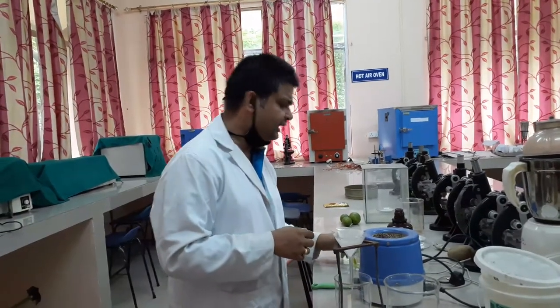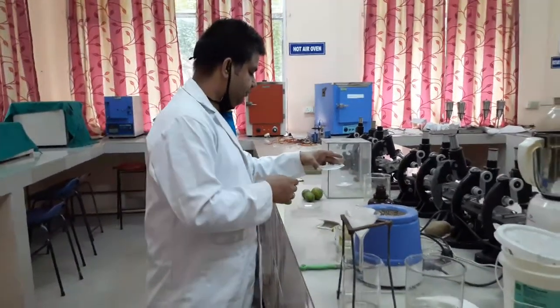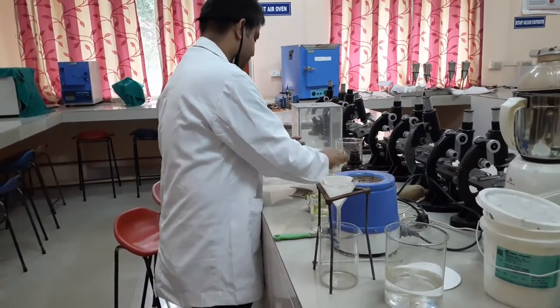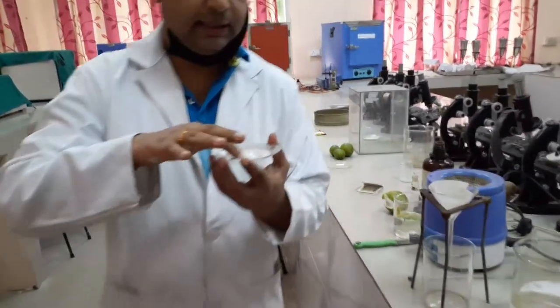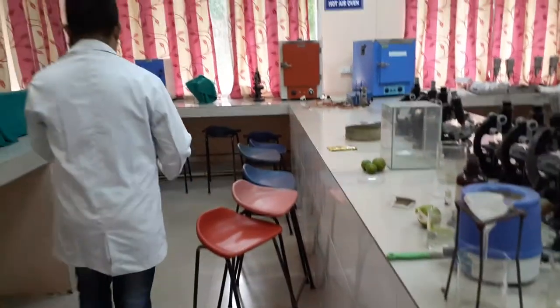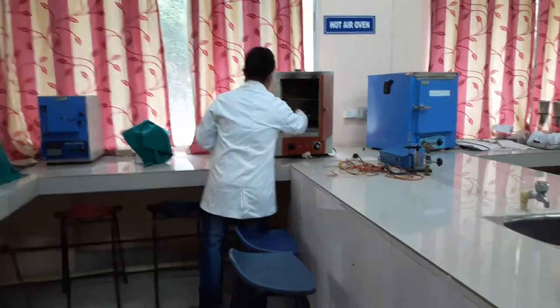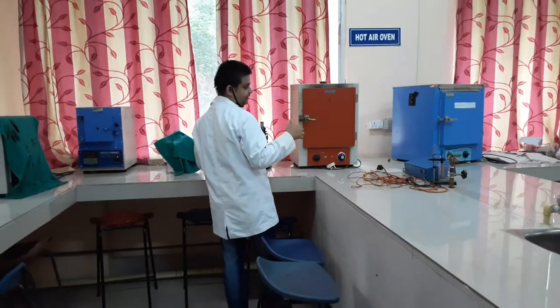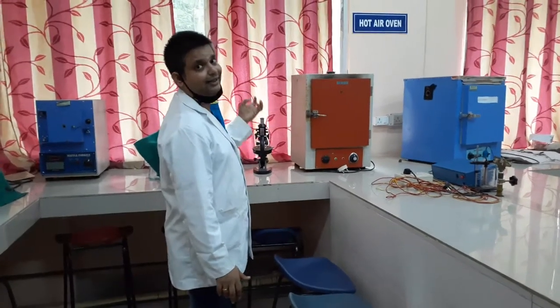You collect it in a dish — in a petri dish. It will appear slightly orange in color. You can see the color here. Now, you dry it inside the hot air oven and you wait for some time — let us imagine 5 or 10 minutes at 150 degrees centigrade. Keep periodically checking, otherwise the entire product will get burned.